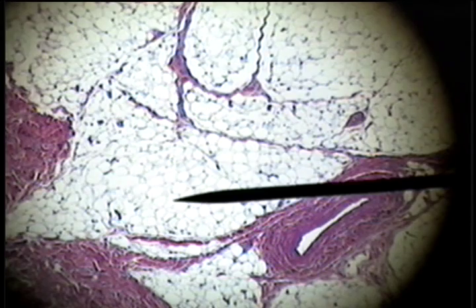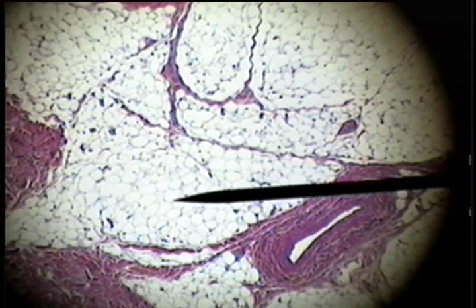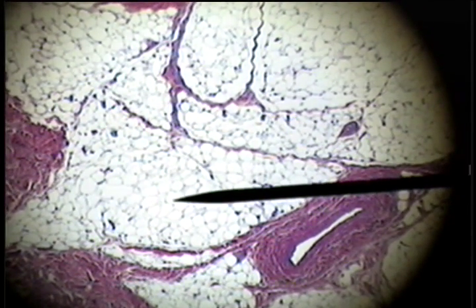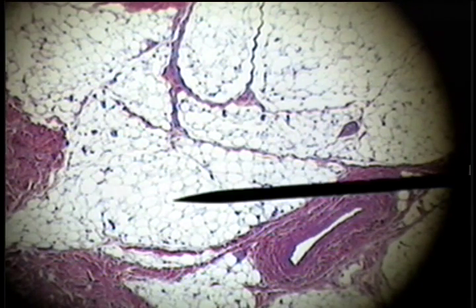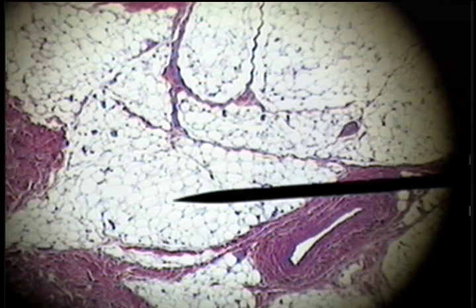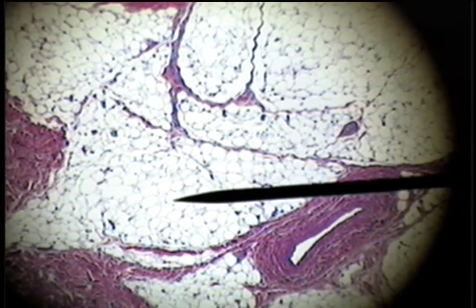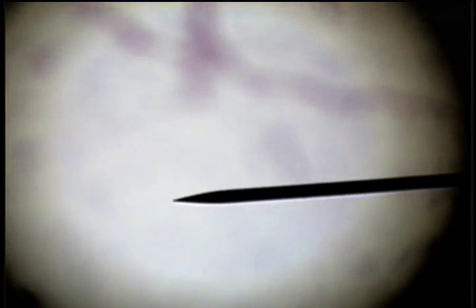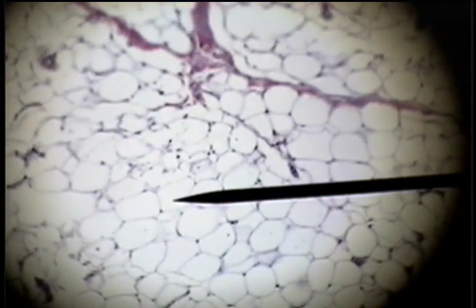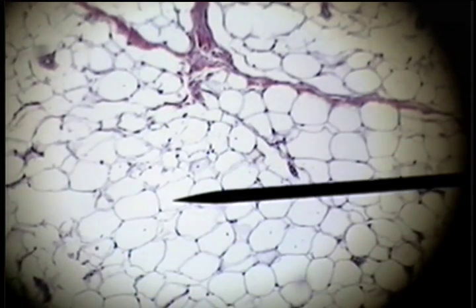The adipose tissue appears as a bubble, a series of bubbles, or fishnet. The lipid has been washed out by the fixative process. If we go down to higher power, we can see that there are nuclei associated with these adipose cells.